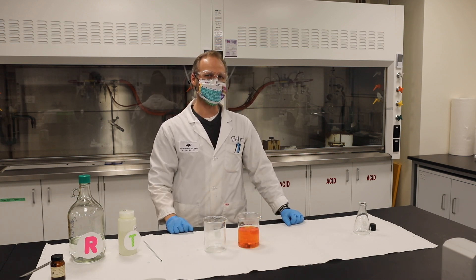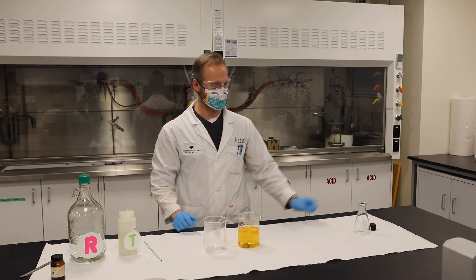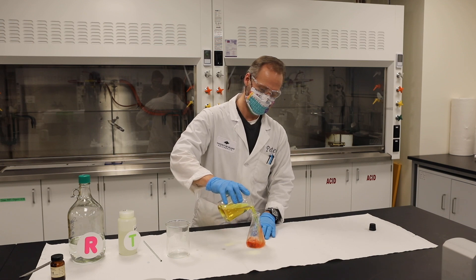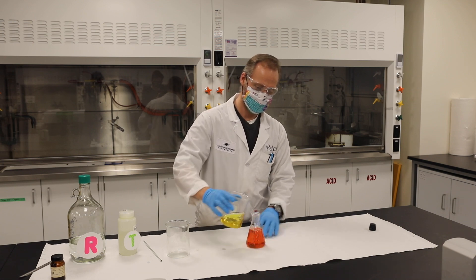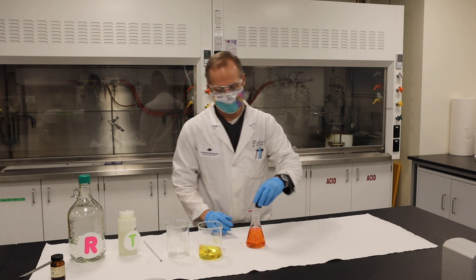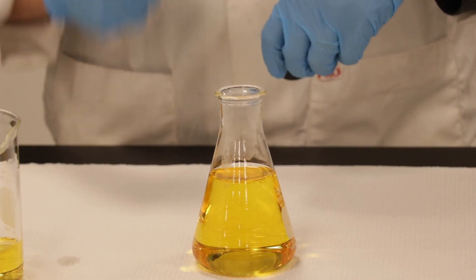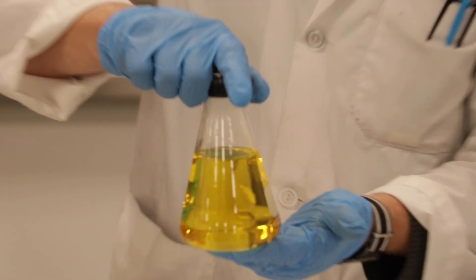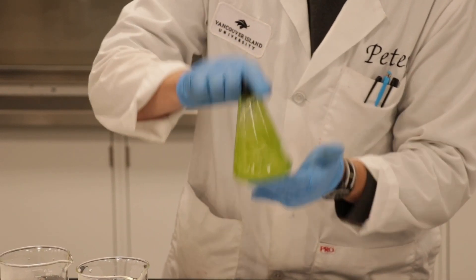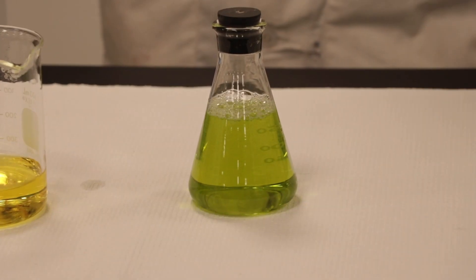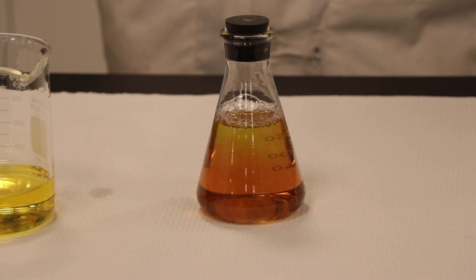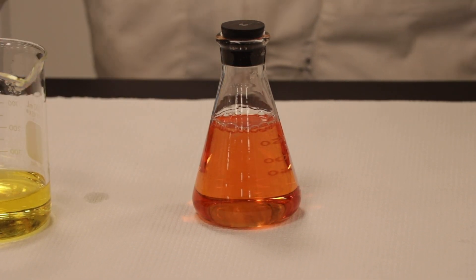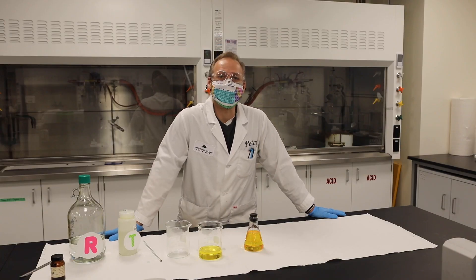Now, I really want to push this fast, I'm a little bit impatient, so what I'm going to do, I'm going to put this in here. We're going to let a bit of oxygen in because it's consuming the oxygen. Now watch what happens. Now, as you can see, it's going from green to red, and back to that really bright yellow that we have over here, and that's an oscillating reaction for you.